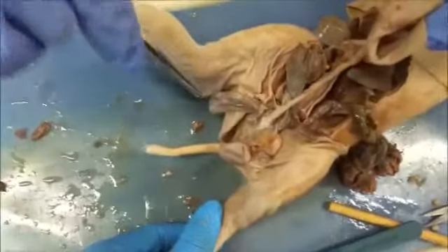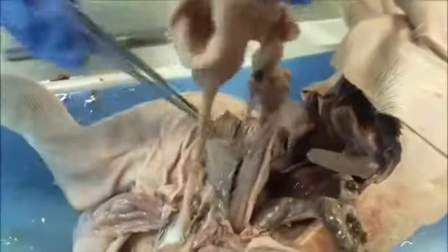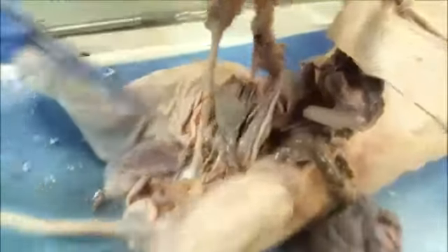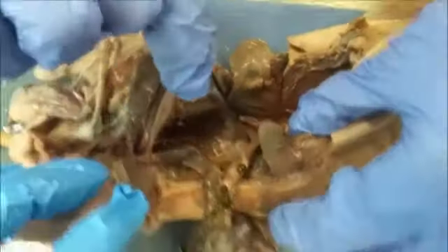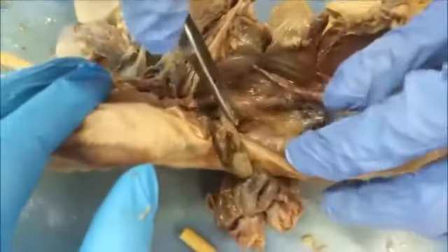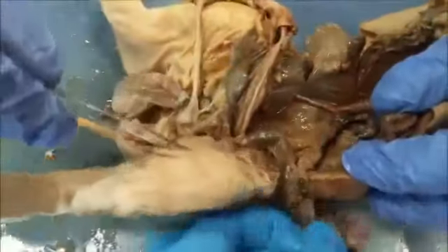Here you can see we cut open the scrotum, and this is the testicle, or the testes. Here is the urethra, and here you can see more defined the umbilical cord with this hard mass, which we assume is the bladder. And here you can see the kidneys right here on one side, and then kind of hidden back here is the second kidney. These will feed into the bladder, and from there waste will be excreted through the urethra.